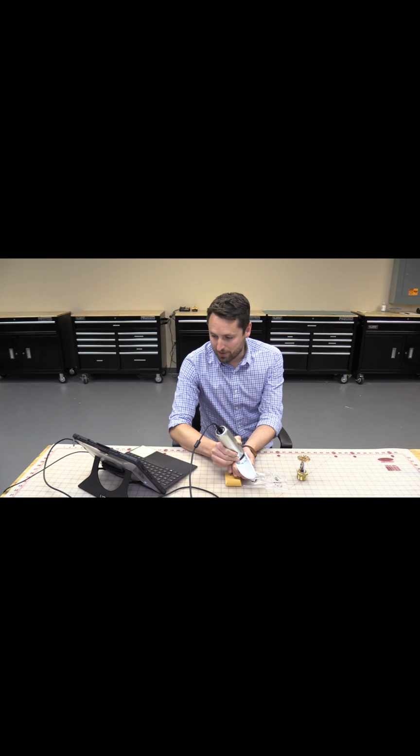Another quick feature that's really nice on these is that you can adjust the light angle. You can see that as we change that, the textures all really change depending on where the shadows are. So that's extremely useful for us to get exactly the image that we want.